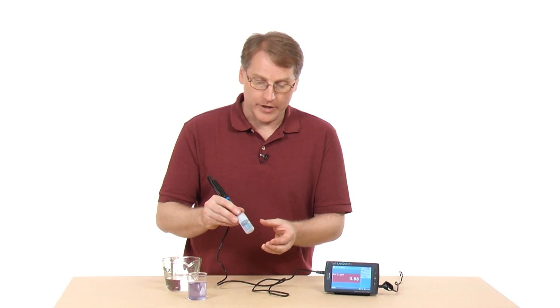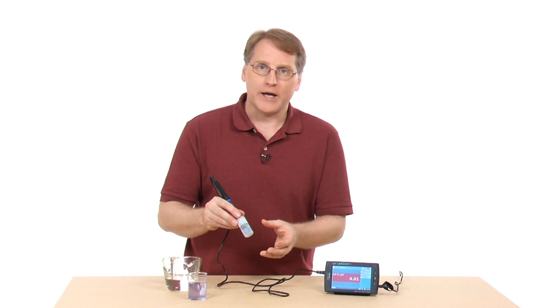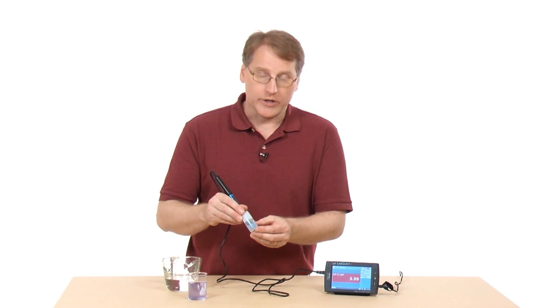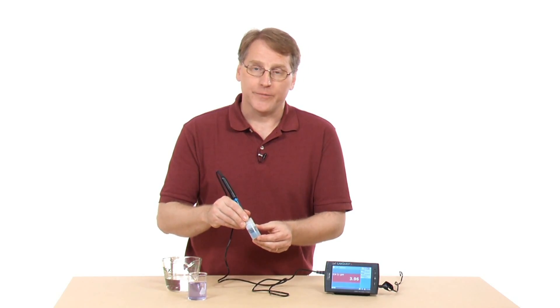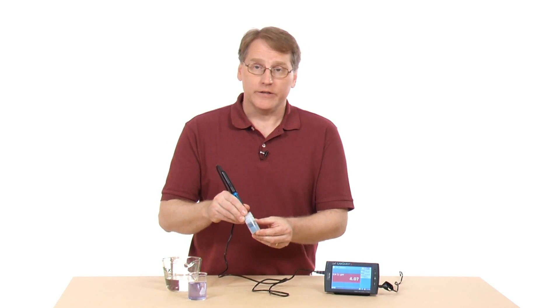You're often interested in the change in the pH value, or you want a measurement where you're not worried about it after the hundredths place or something like that. So you can use the stored calibration on there. You can calibrate it if you want to.